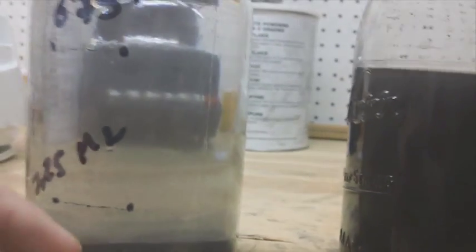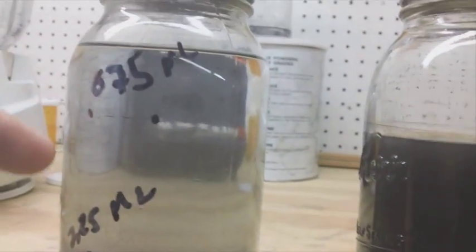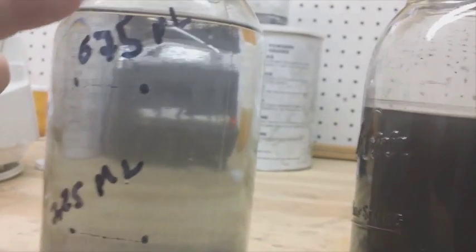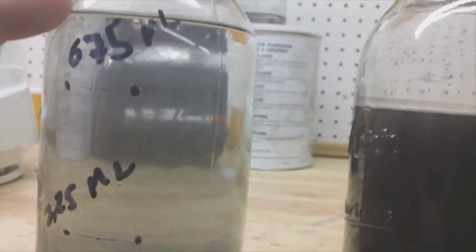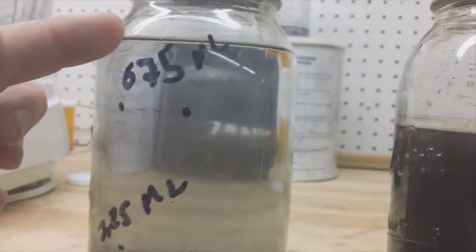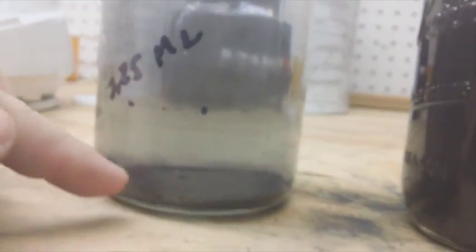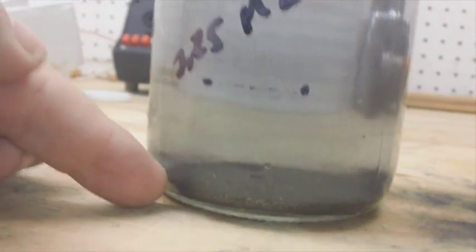This is a prep, this is what I'm mixing to put in the blender. I'll show you how to do these marks, but basically this is the mark right here of the pre-mix that I put in the blender with the 40 grams of graphite. And if you can tell, that's perfectly clear, the graphite is settled at the bottom.